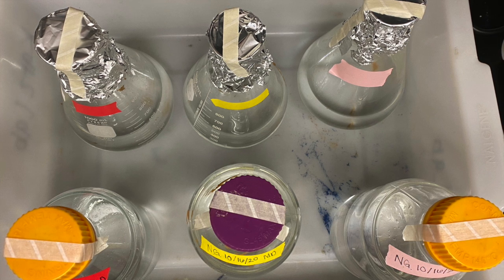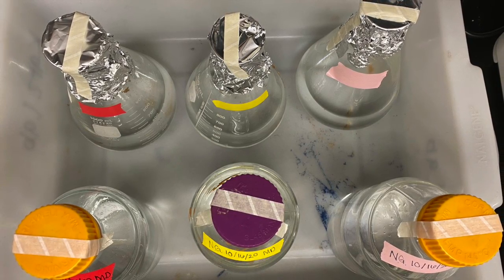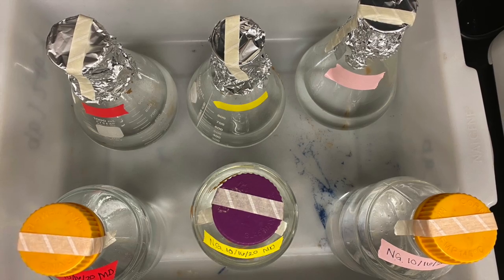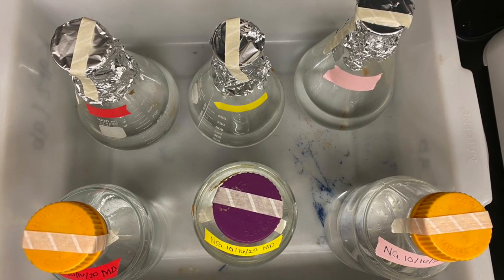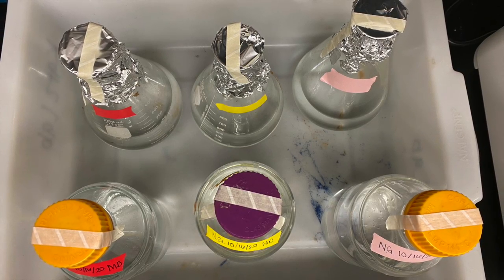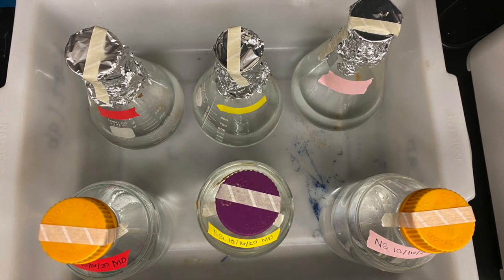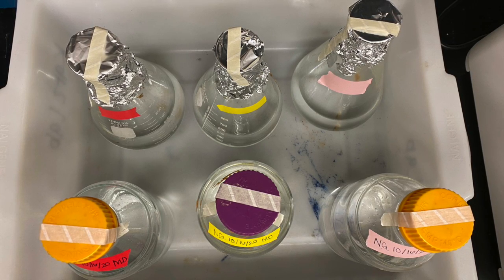Make sure to place your media solutions into a secondary autoclave-safe container. Also, divide any full bottles, such as the 1-liter Pyrex bottles, into two 500 milliliter vessels. Remember to unscrew any tight caps and always use autoclave tape to indicate whether the autoclave run was successful.